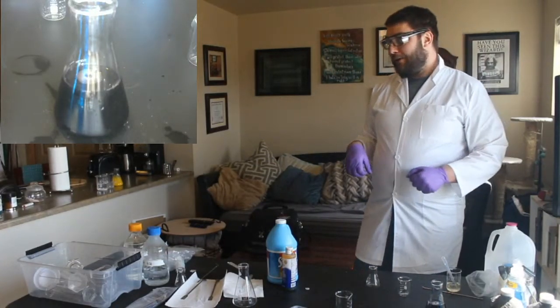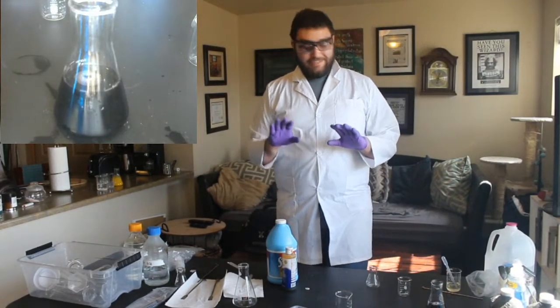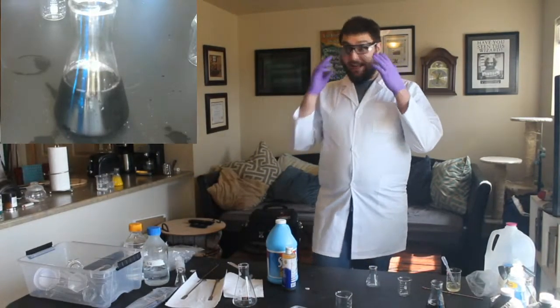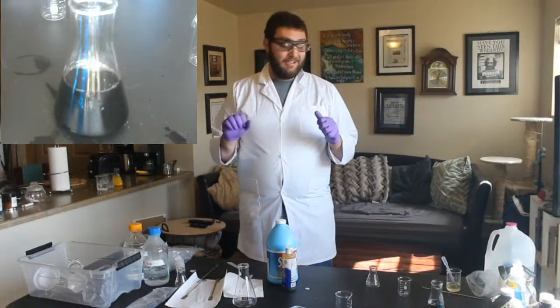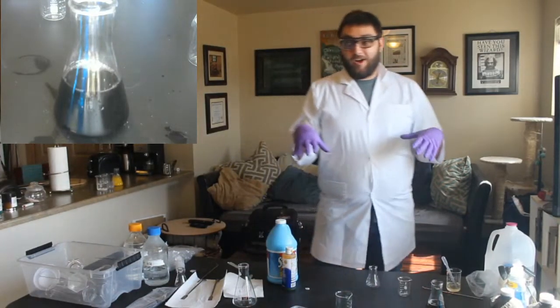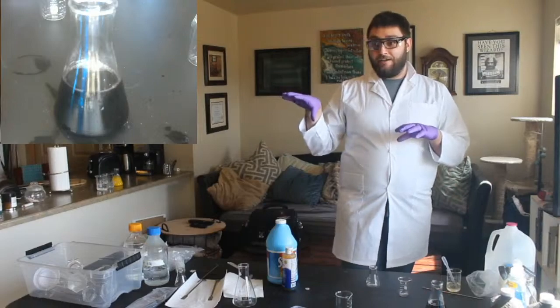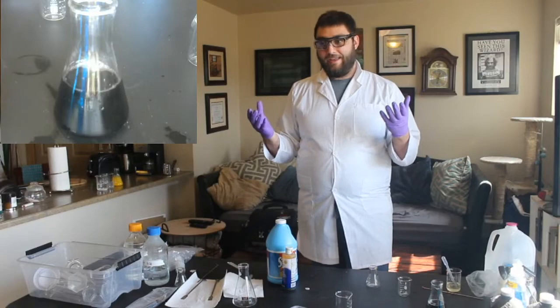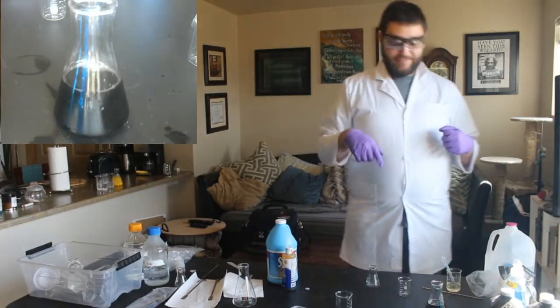Sweet. So, one place you might see this as a magic trick, and because a lot of magic is really just science that people don't explain. So we've been doing magic all day, right? We've been turning clear stuff into not clear stuff, which might be magic if we didn't explain it. But since we explain it, it's science.